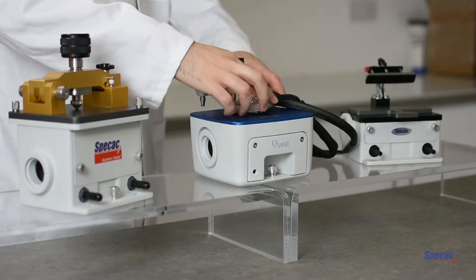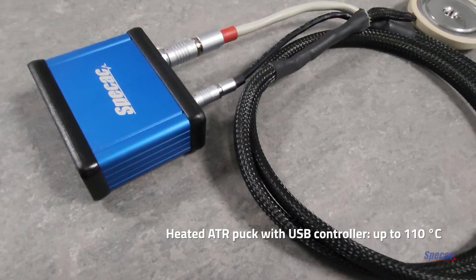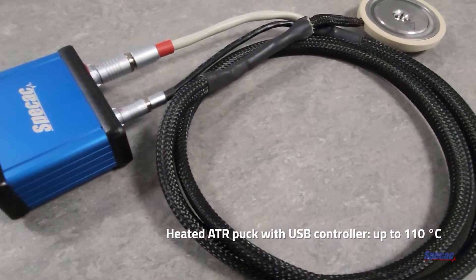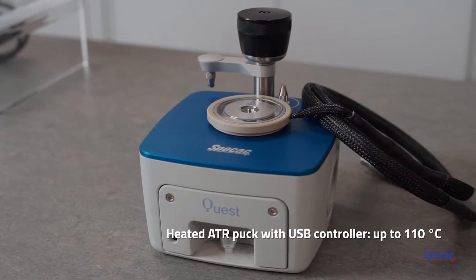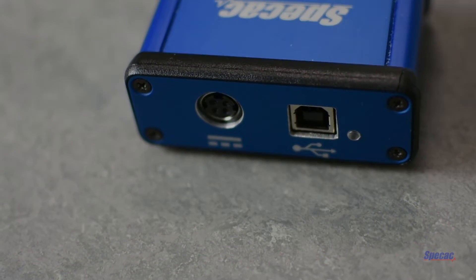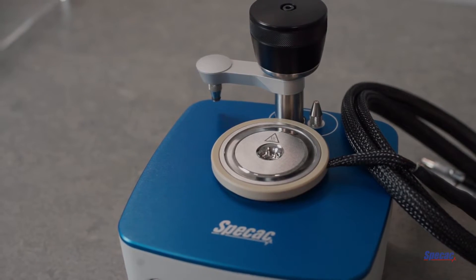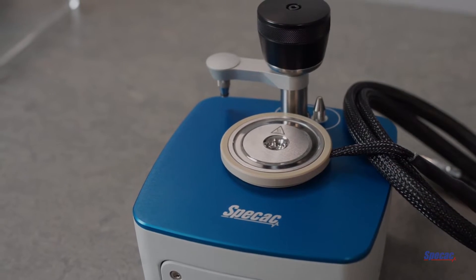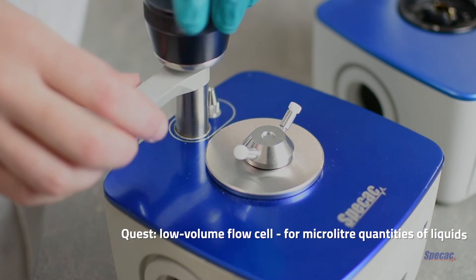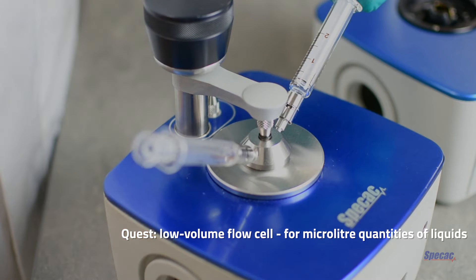The Quest ATR can analyse samples from room temperature up to 110 degrees Celsius when using a heated ATR puck such as shown here. This is controlled using dedicated software via a compact USB link. With the Quest, we also have the ability to use a low volume flow cell to analyse microliter quantities of liquids.